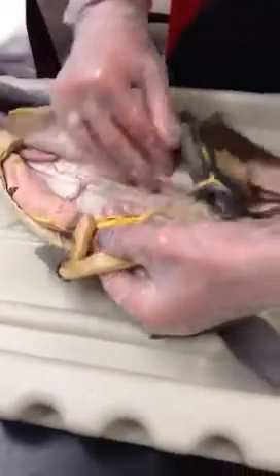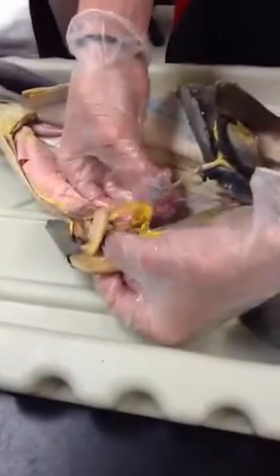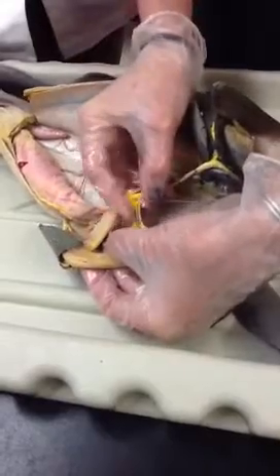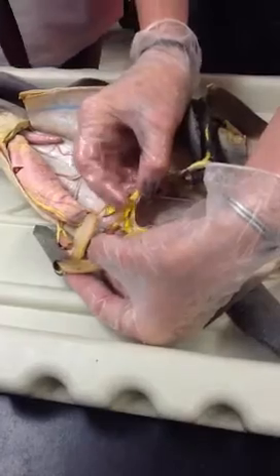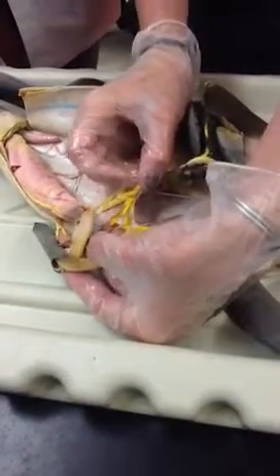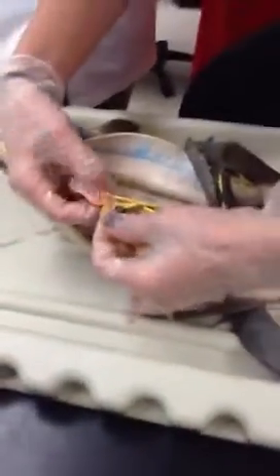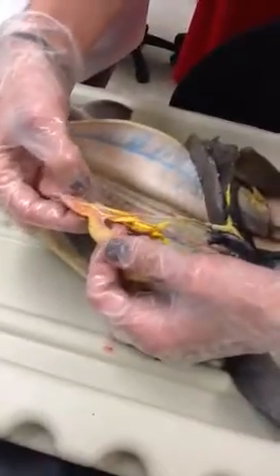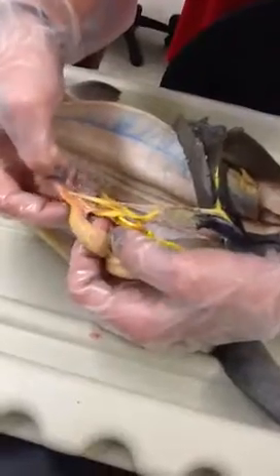Your pancreas, and then, yes, you're going to have gastric. That splits into your pancreaticomesenteric, right? Yeah, I believe that's this one here. The first branch should be your pancreaticomesenteric. And then from there it splits off into 3. And then from here it also splits down into the intraintestinal, right? Yeah, our intraintestinal here.